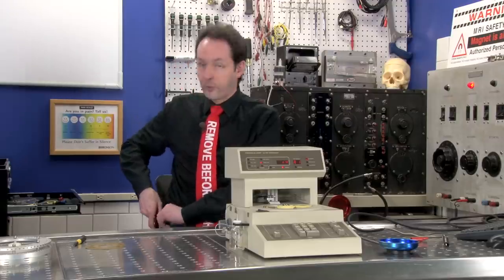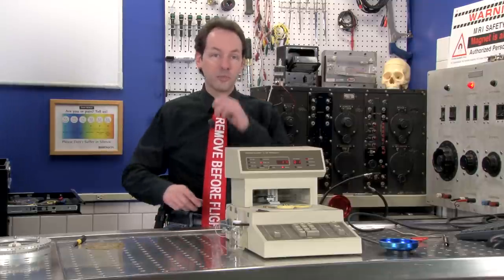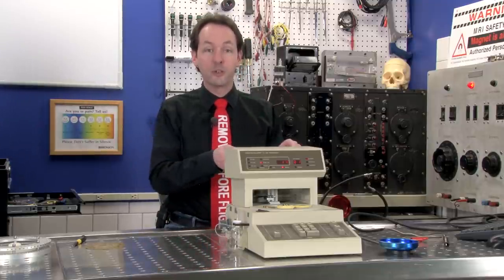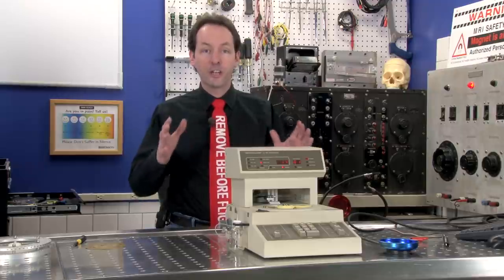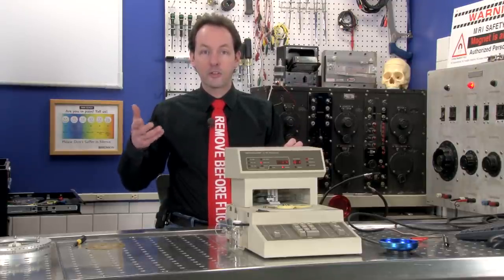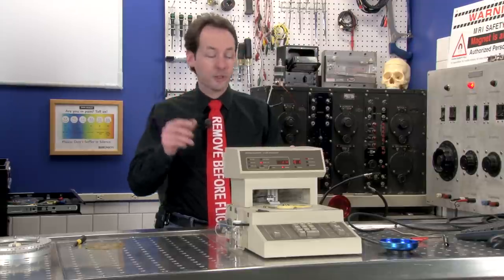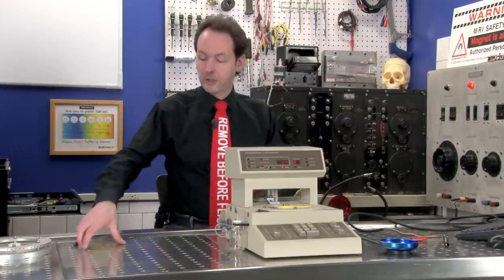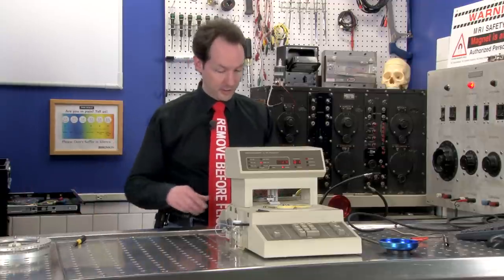And that, by the way, is if you've ever spent any time around computers, it's why memory sizes are always one, two, four, eight, 16, 32, 64, 128. Yeah, like gigabytes. Same thing. So, it's a binary wheel and that is awesome. And I am keeping that.